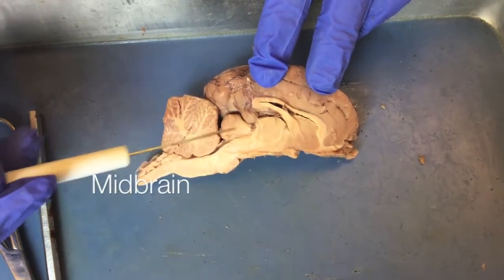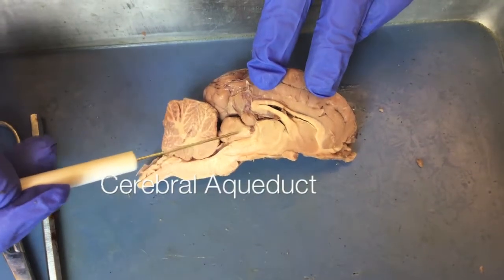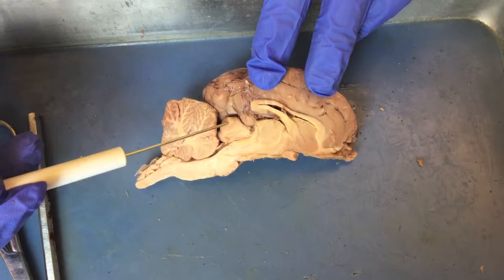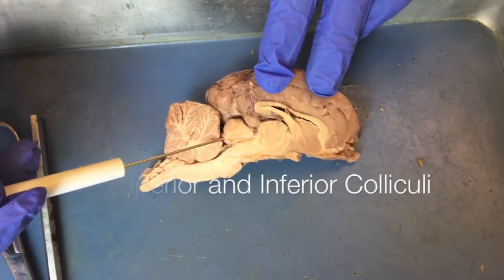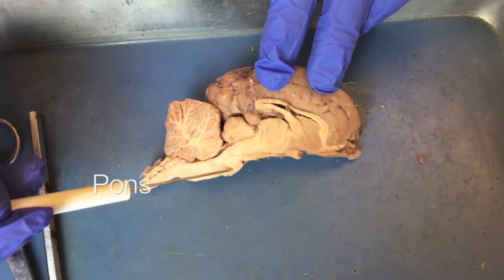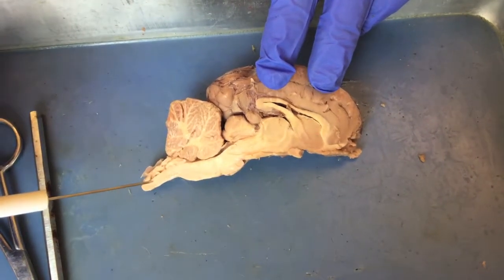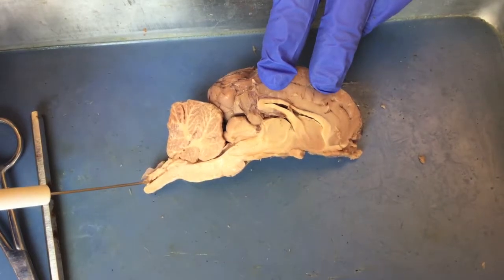To review, this is the midbrain here. We have the cerebral aqueduct passing through the midbrain. This is the pineal gland. This is the superior colliculus. This is the inferior colliculus. This is the pons. This is the medulla oblongata, and this is the spinal cord. This is the central canal of the spinal cord.